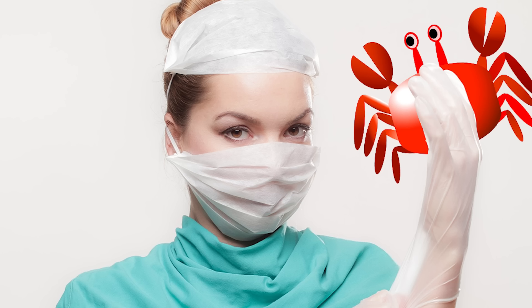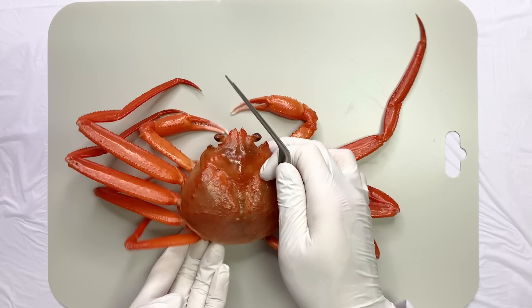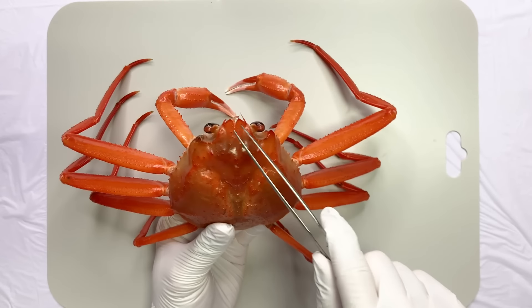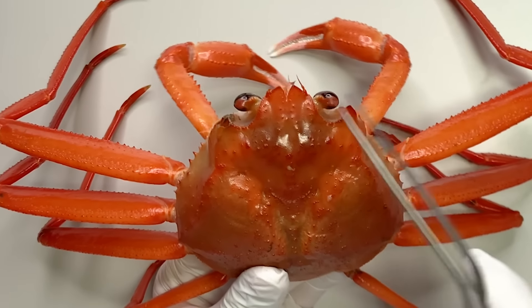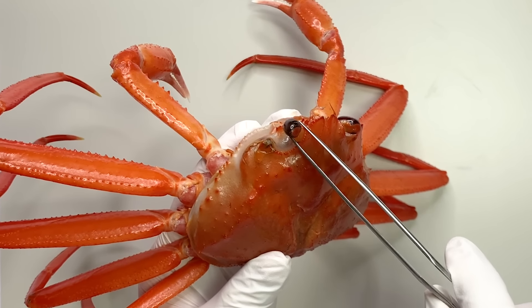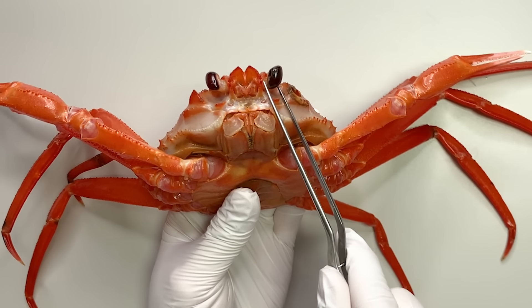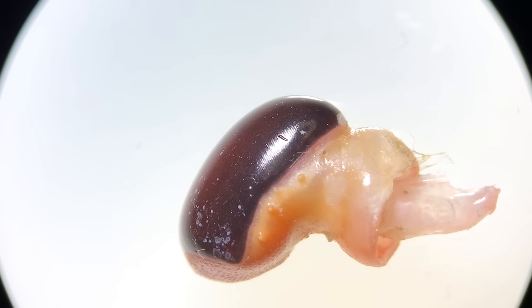Let's observe the body structure of the crab. First, if we look above the cephalothorax, there's a hard rostrum. And next to it, there are eyes. Crabs have eyes attached to the ends of eye stalks, and they have compound eyes, similar to insects.